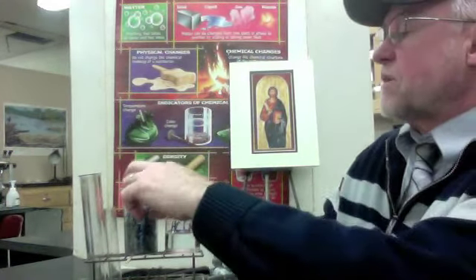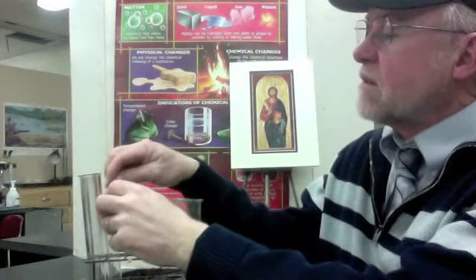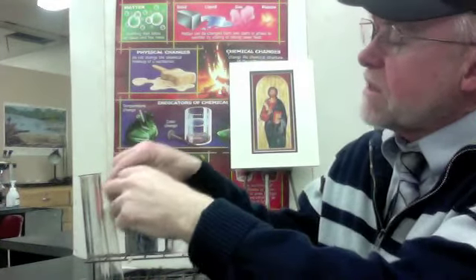I'm going to take some pieces of zinc. Okay, pieces of zinc into the test tube.